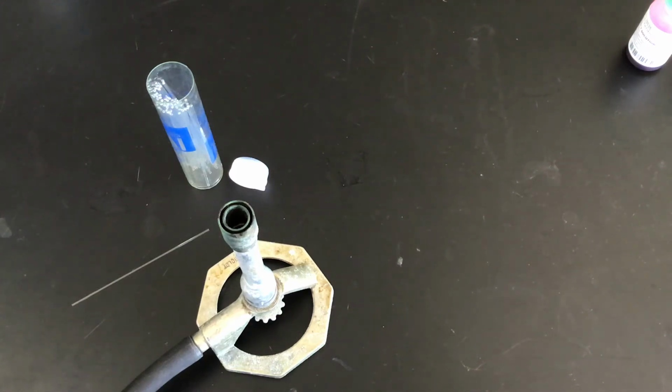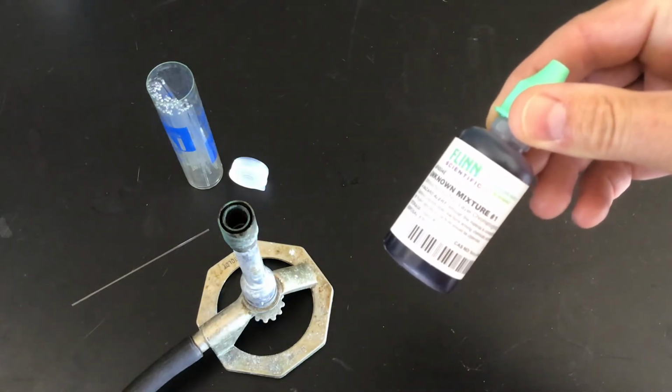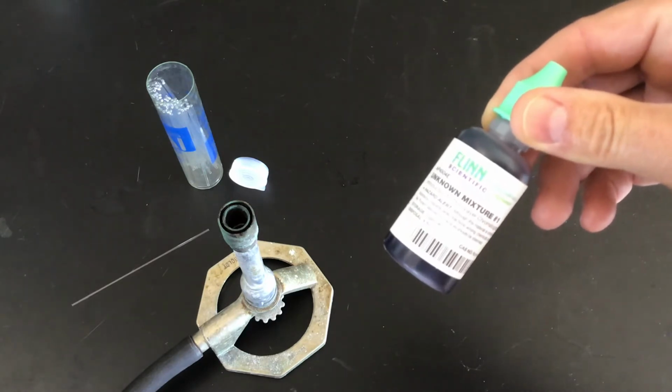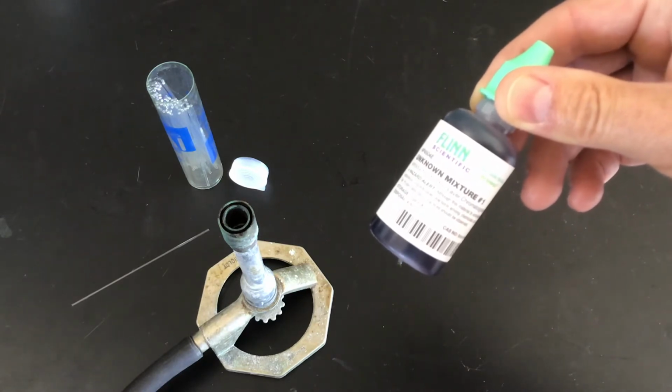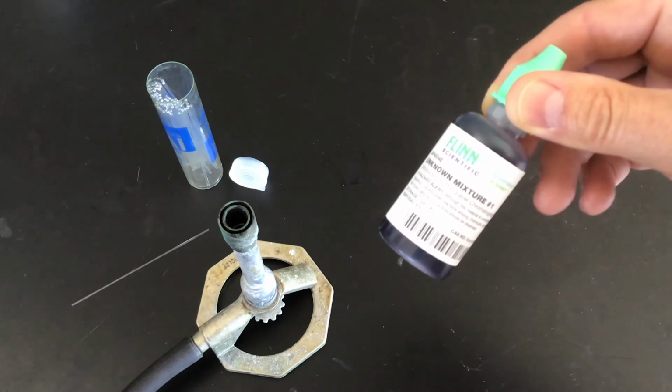What I want to do is go over our TLC or Thin Layer Chromatography Lab and the idea behind it and then how to do it. So the problem that we're going to try to solve is that we've got a few unknown mixtures that have a few different dyes or stains in them. And we actually have 3 of these. Our job is going to be to figure out what dyes we have in here using the idea about chromatography, that separation technique.